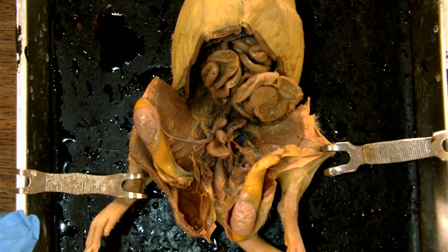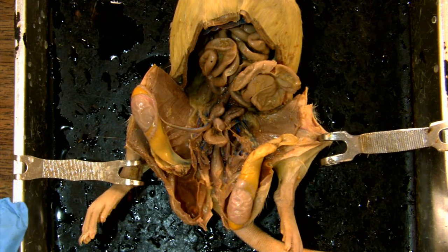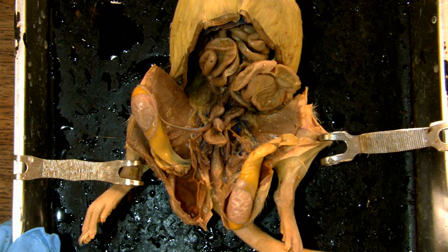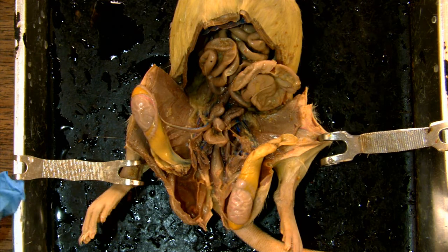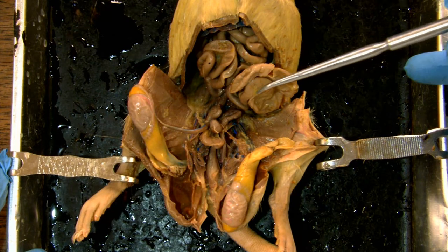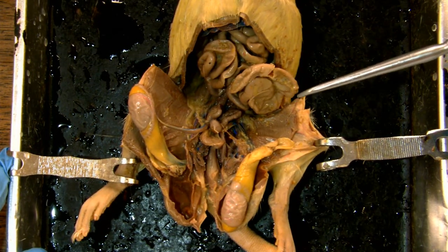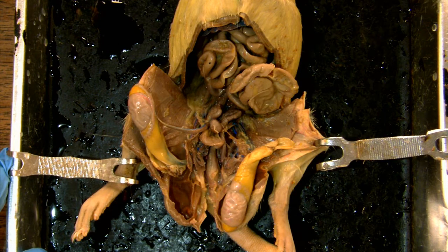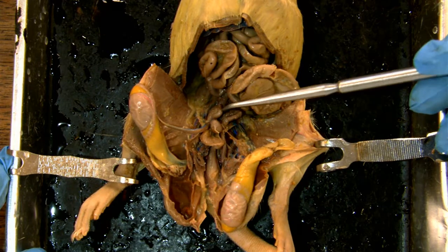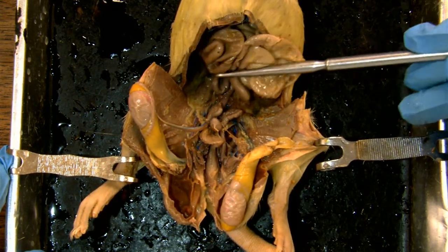Here you can see that I've dissected the male genital region of the rat, and I want to go over a few structures — primarily the glands that are involved. In the male animal there are a lot of glands involved in the production of semen and sperm, starting at the top of the animal, or near the head.